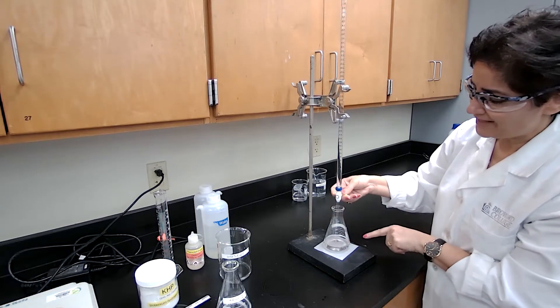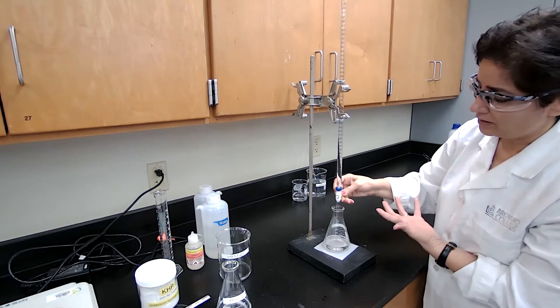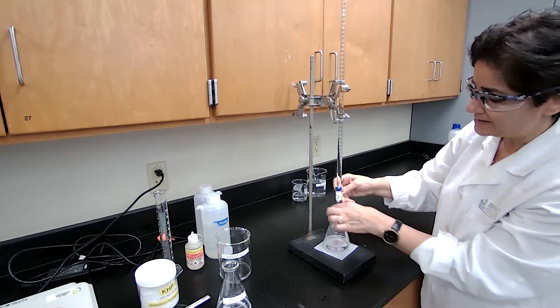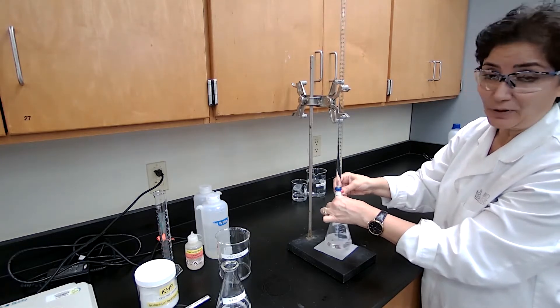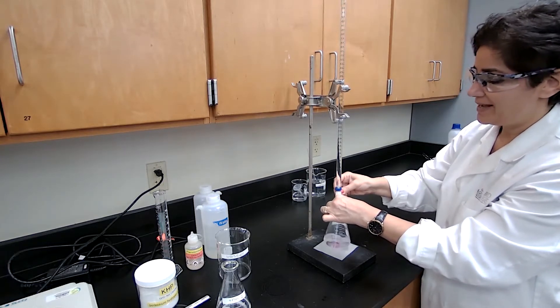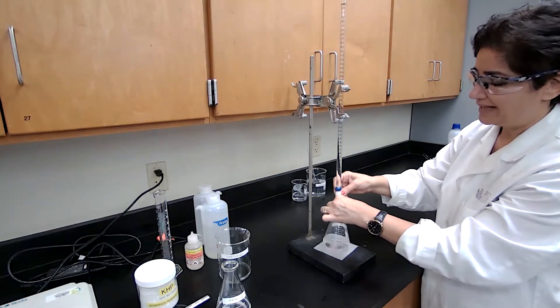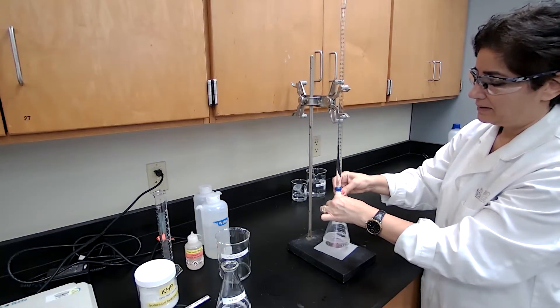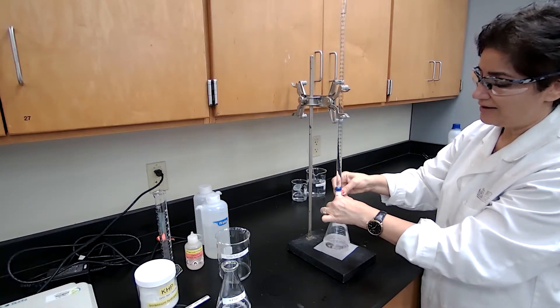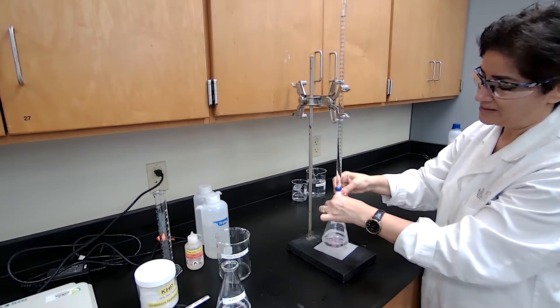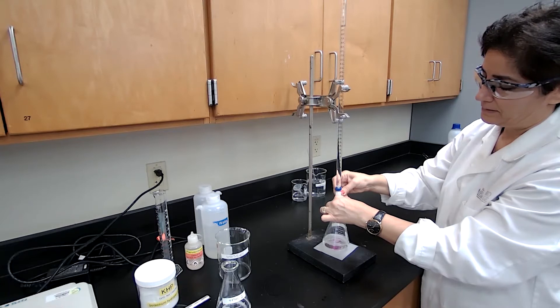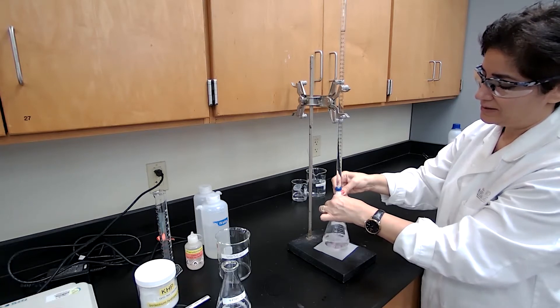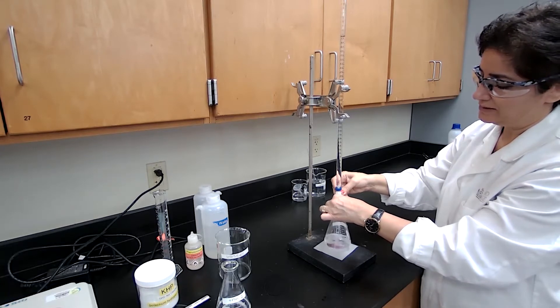But if the life of that pink color is longer—that means the pink color appears but it takes longer time for it to disappear—at that point, I have to be careful and add one drop at a time. Especially for the first trial, I have to be careful and add slowly until the color change is stable for 20 seconds.